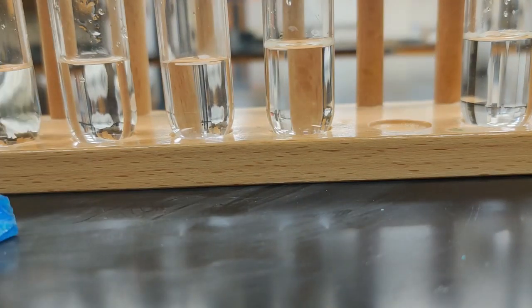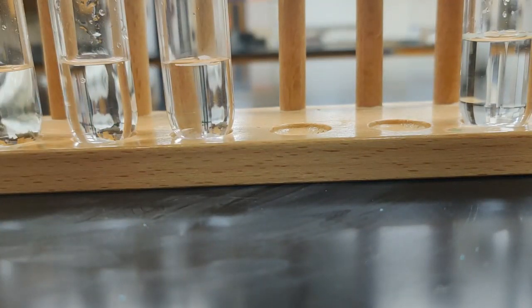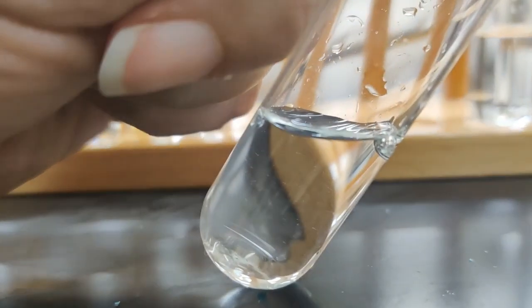Alright, our next one we're going to test is some copper 2 sulfate, which is a blue solid. So I'm going to put that blue solid in there, and we're going to agitate for a minute and see what happens to our blue solid. Remember, this is what it looks like in the bigger chunks. Oh, okay, so let's see what I get. I put in one bigger chunk and some smaller pieces. And I do see that this bigger chunk probably is still in there.